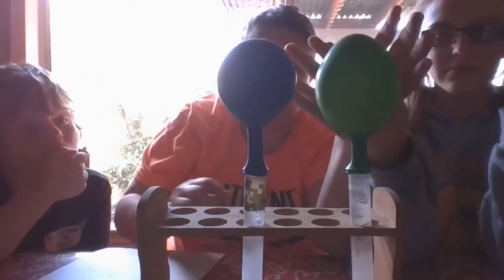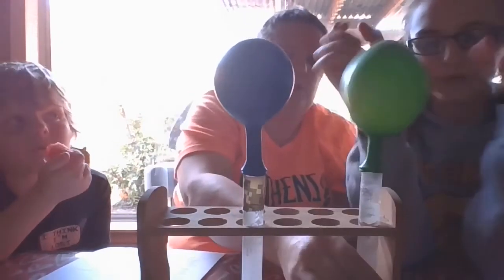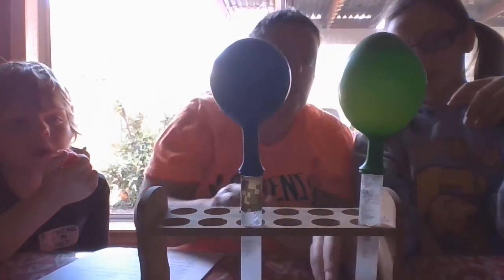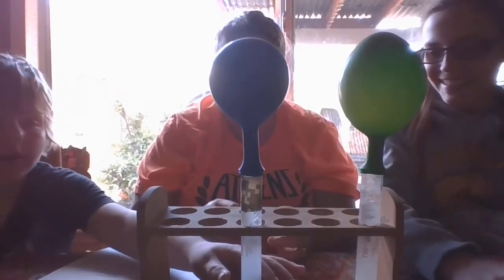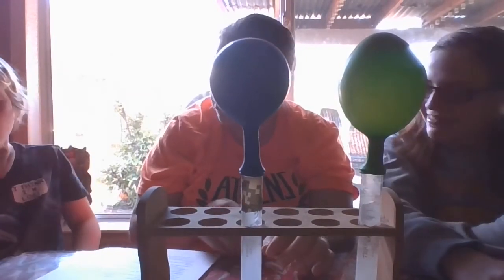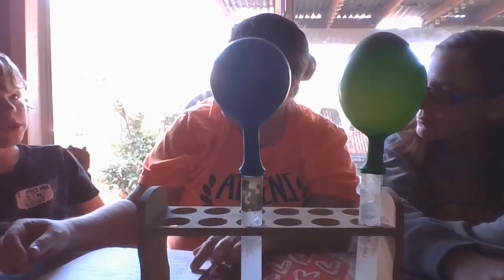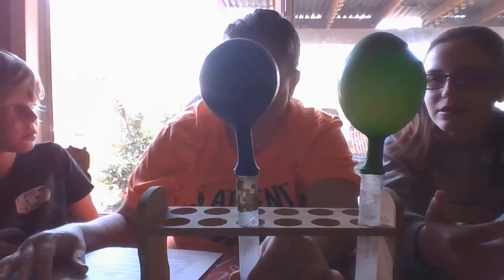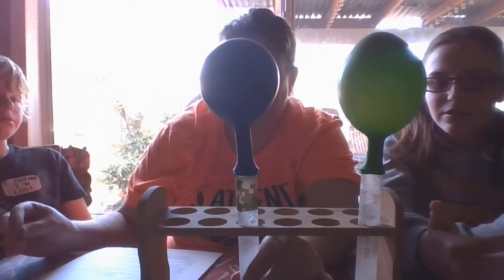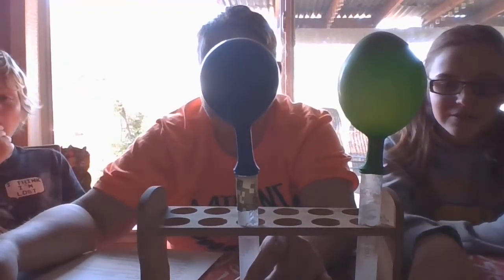Is it warm? I don't know. You can touch the test tube. Nope, it's cold. It's actually a very cold test tube. Okay, so now that you've seen this, feel that? It's cold, huh? Usually when you do this, is it warm or cold? Nope, it's cold. Yep, it's cold. Chilly. So, which reaction had the fastest rate?